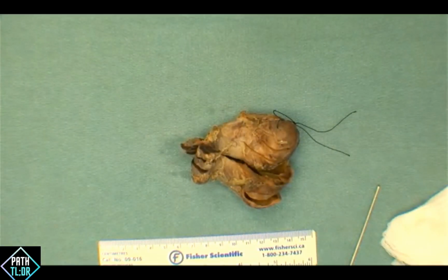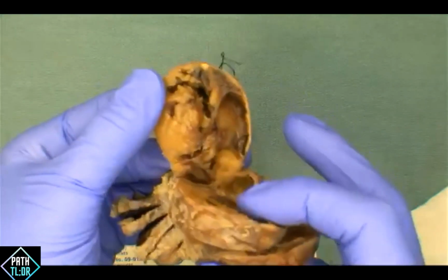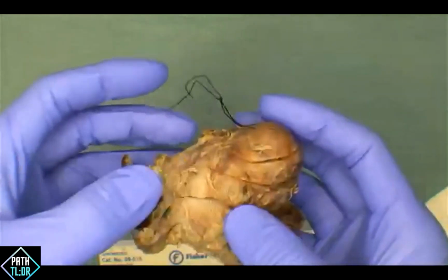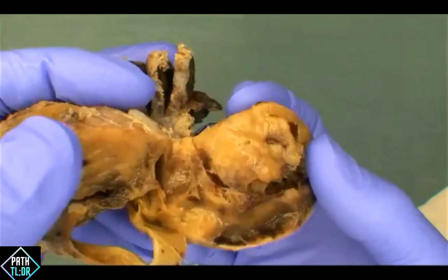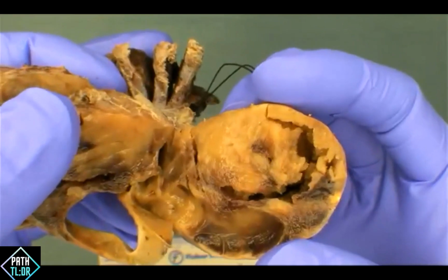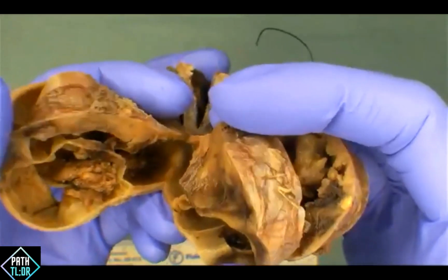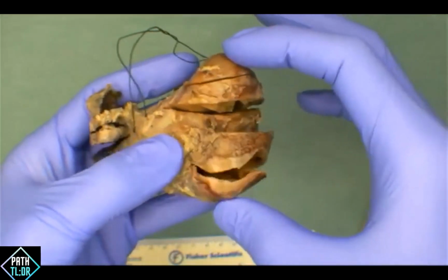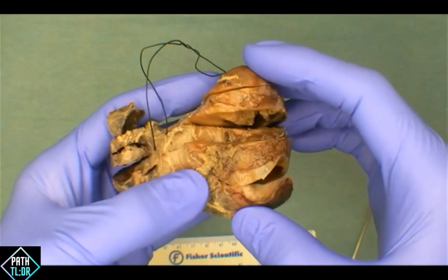From a section standpoint, we talked a little bit about these very fleshy follicular type nodules. Sampling the periphery and the capsule of these nodules is vitally important. If this was a papillary lesion, we'd probably just take representative, but given how fleshy it looks, follicular type lesions are higher up on the list. And so it would be important to then sample the periphery of this nodule in its entirety from top to bottom. When it comes to sampling the poles of each of the thyroid lobes, there's definitely some variation in the community in terms of how you sample that.